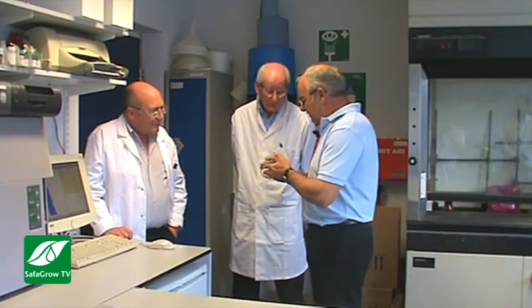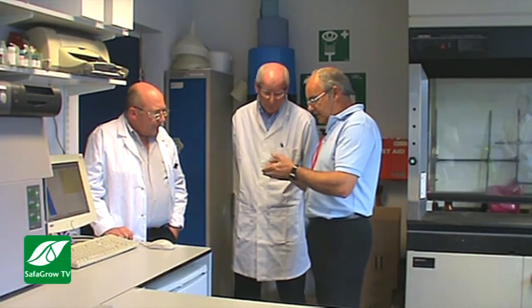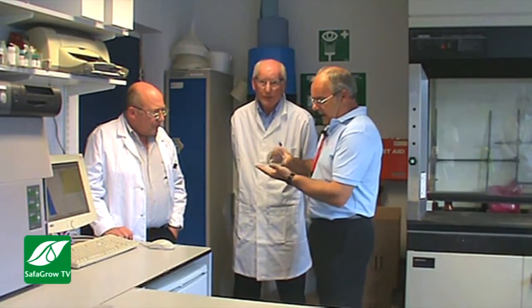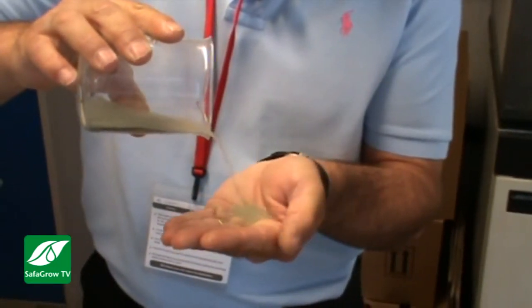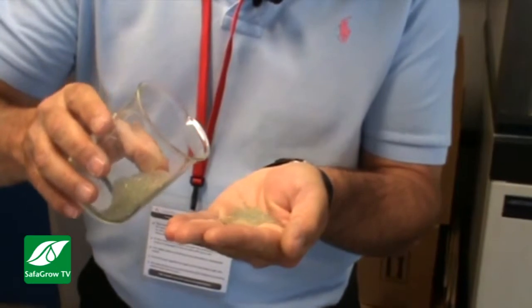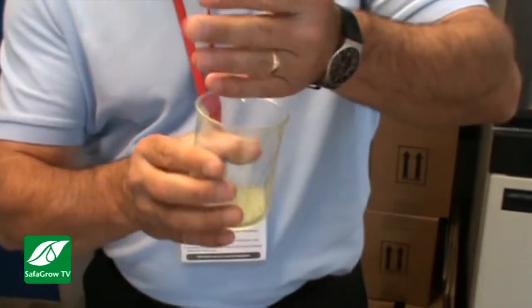John, part of what we'll see later, I guess, because you've offered us a trip round to have a look at some of the machinery. Here is a beaker of what looks to me to be fairly coarse sugar or glass balls, very tiny glass balls. Yes, they are soda glass beads, nominally 1.5 millimetre in diameter. They go into our mills, and we'll see those a bit later.